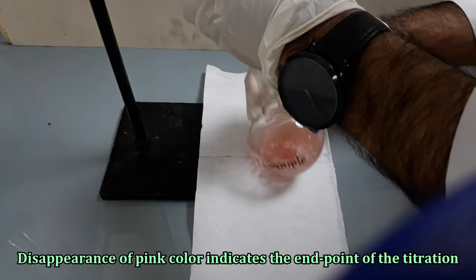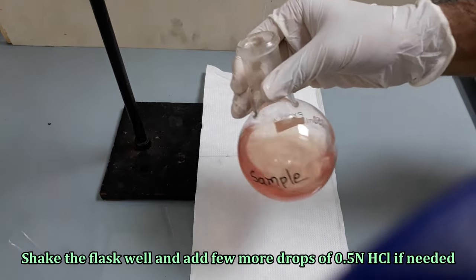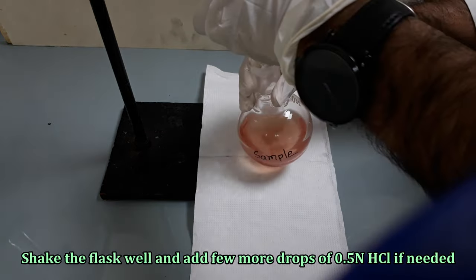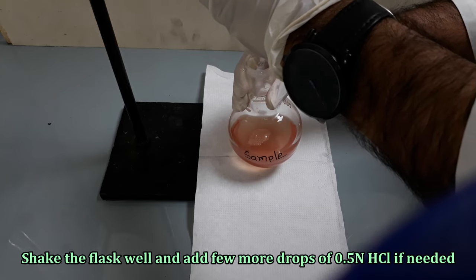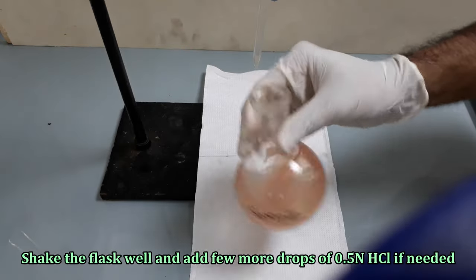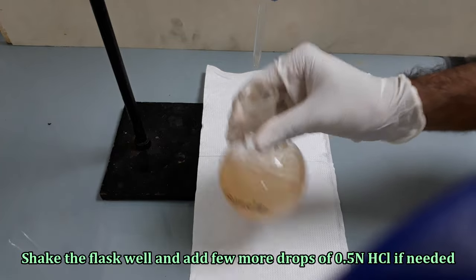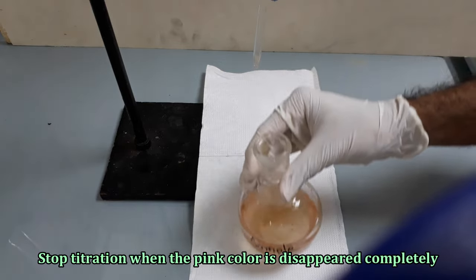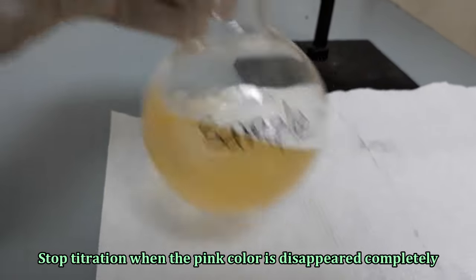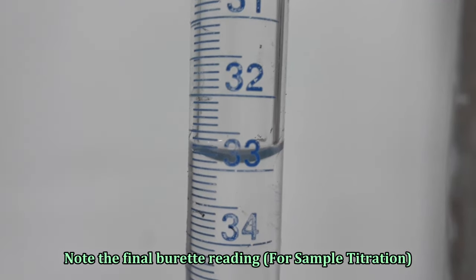Disappearance of pink color indicates the end point of the titration. Shake the flask well and add a few more drops of 0.5 normal hydrochloric acid if needed. Stop titration when the pink color has disappeared completely. Note the final burette reading for the sample titration.